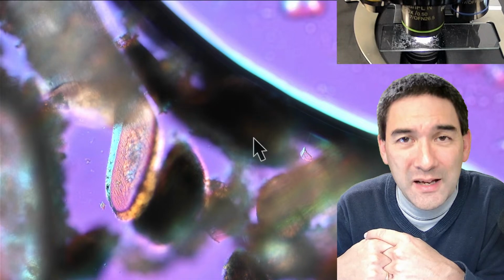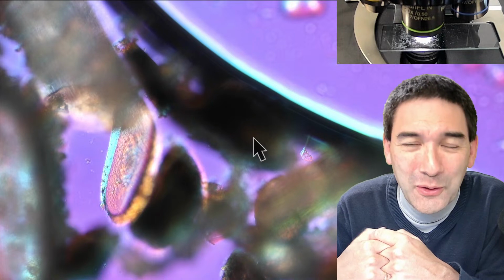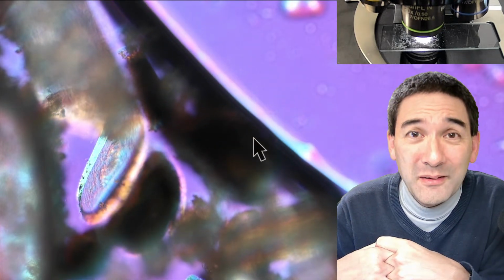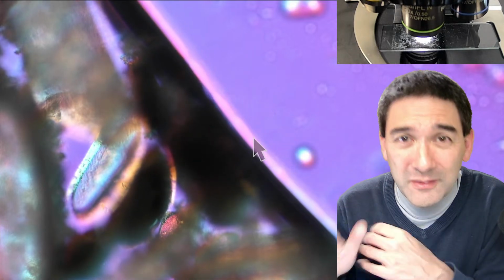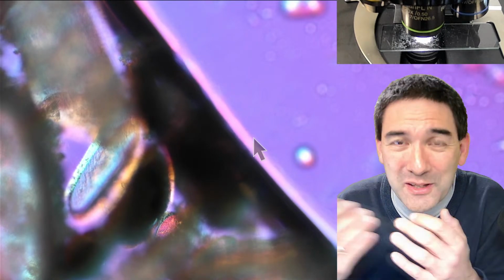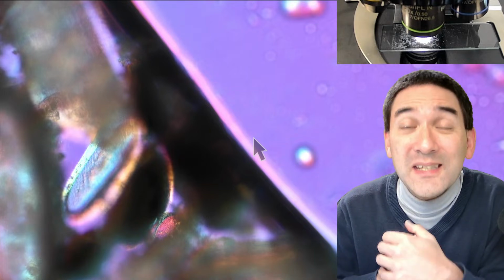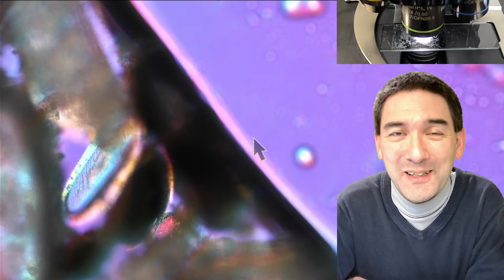I've already promised you last week, and I'm working on it, to make the pictures available of the sea urchin spines, the cross sections. I'm also in the process of ordering glycerin gelatin, which is also a water-based mounting medium. It is pretty good for mounting pollen. I know it's now autumn, so it's not pollen season, but if we figure out how this works, then when spring comes we can mount some pollen using glycerin gelatin according to Kisser. They're different recipes, and the one according to Kisser is the standard mounting medium used for pollen. So you can already see that for mounting different specimens, different mounting media are recommended.